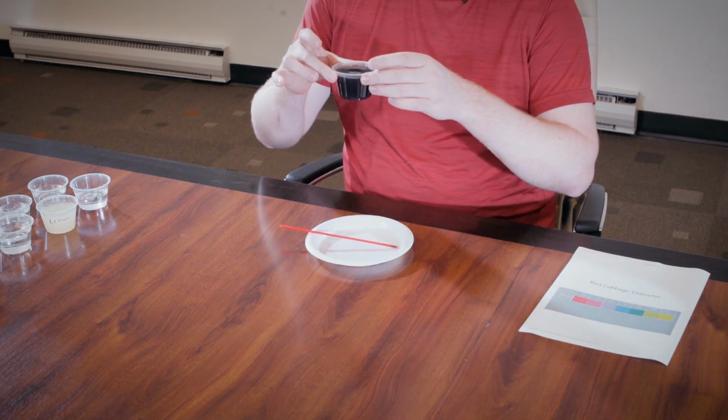We often see acids and bases react strongly together, such as the case with vinegar, which is acetic acid, and baking soda, which is sodium bicarbonate. What I have done is I have created something that is called an indicator.